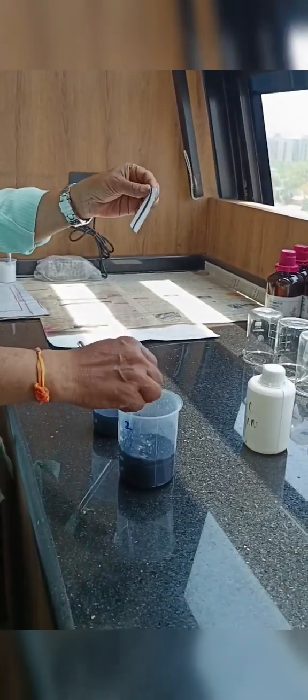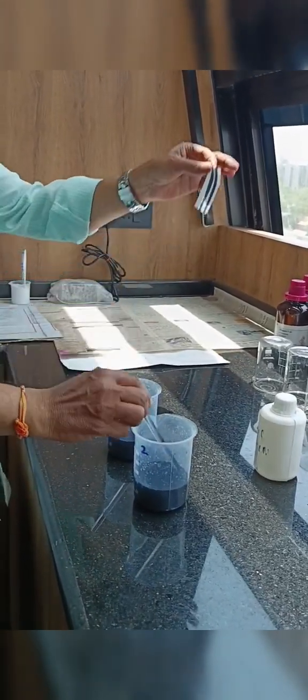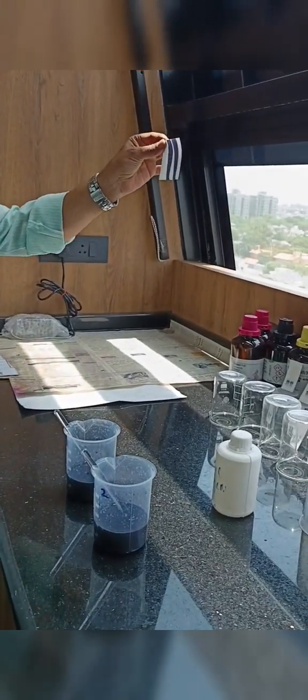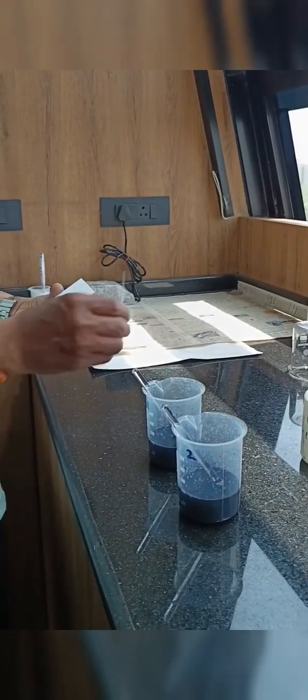As you can see, there are no lumps. Now to perform TLC there is a special sheet known as TLC silica gel. We will make spots on the TLC sheet using a capillary.